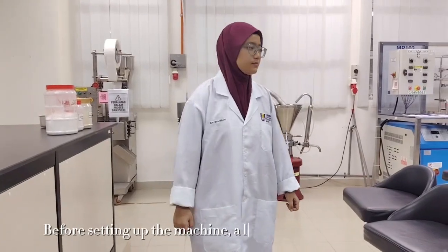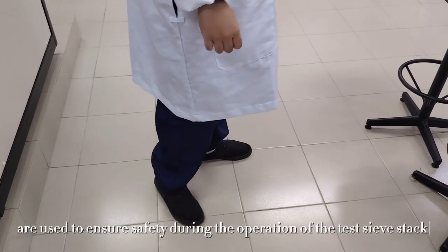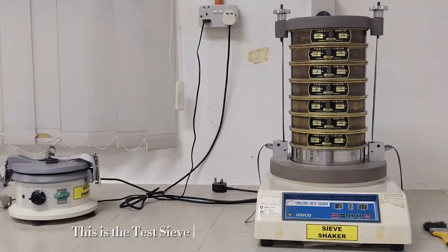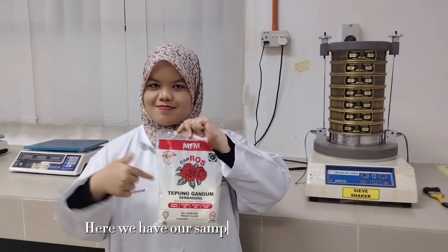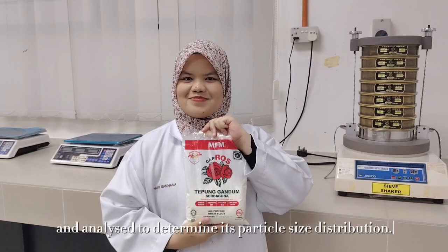Before setting up the machine, a lab coat and safety shoes are used to ensure safety during the operation of the test sieve stack. Before we begin, let's take a look at the main equipment used in this experiment. This is the test sieve stack and sieve shaker machine, which helps separate particles according to their size through vibration. Here we have our sample, which is wheat flour. This sample will be placed into the sieve stack and analyzed to determine its particle size distribution.